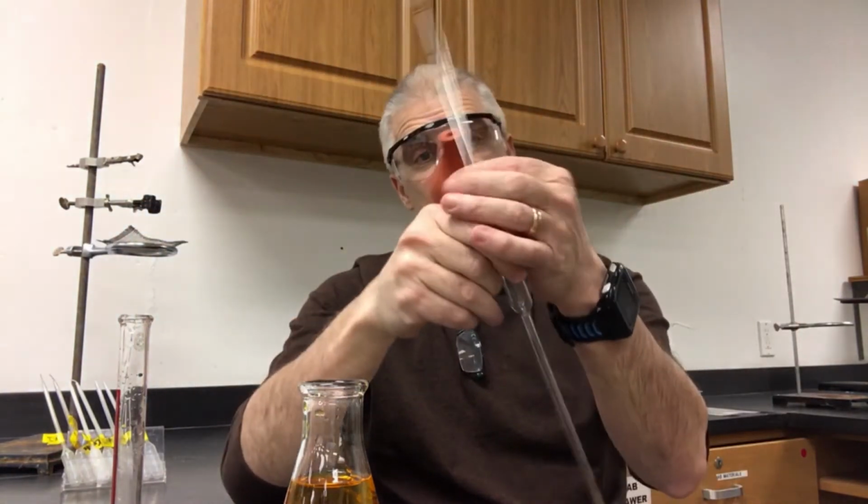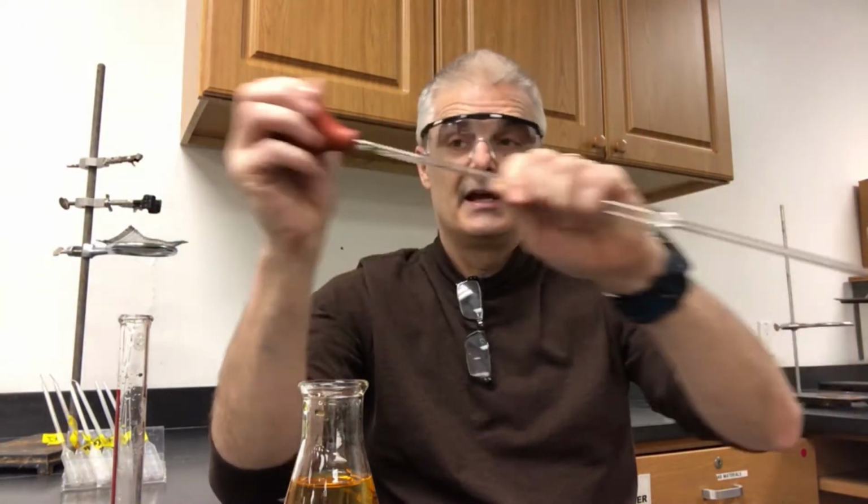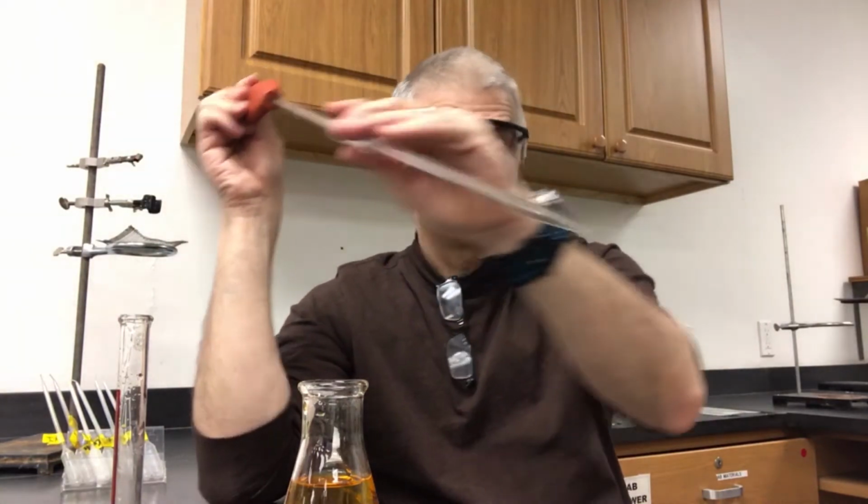Now the art, how do you do this? So I've got a bulb, and I stick it on the end. I squeeze it. I hear air popping out.